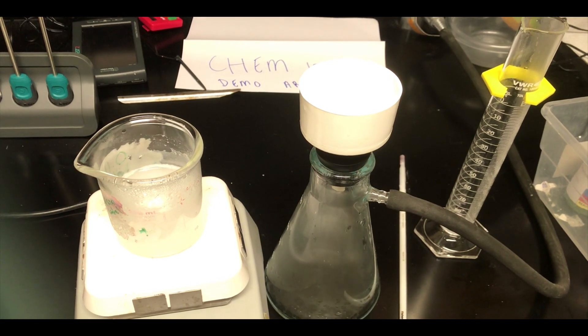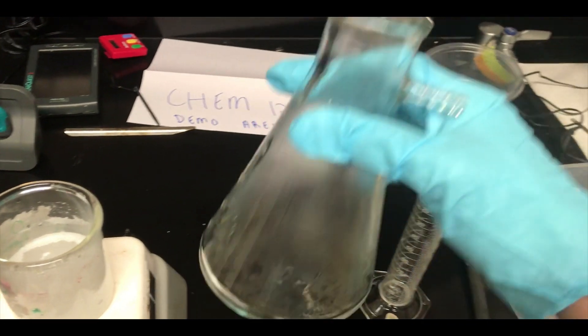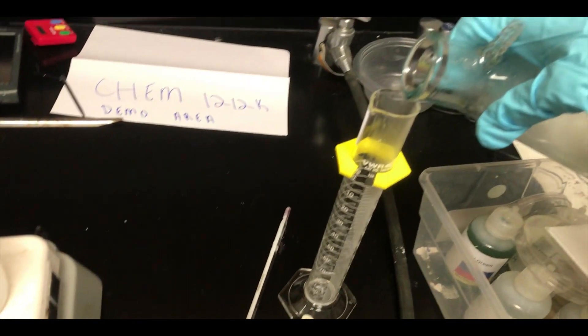So we're only going to titrate now what is dissolved in the aqueous solution. All right, so now I've turned the vacuum off, broken the vacuum, and I have my saturated magnesium hydroxide filtered and ready to go.